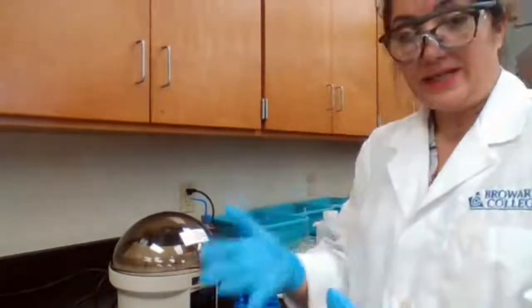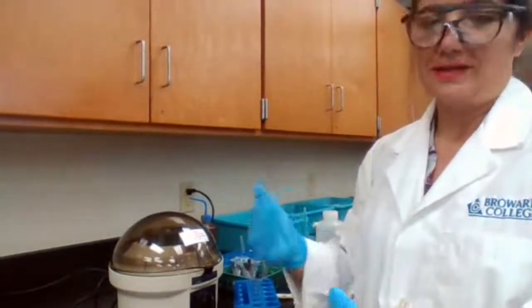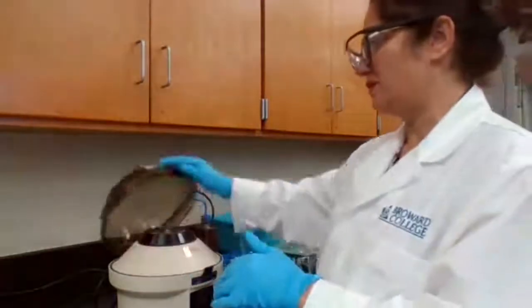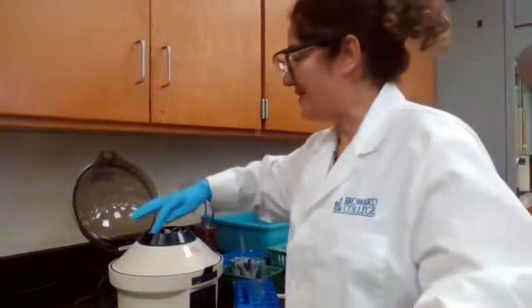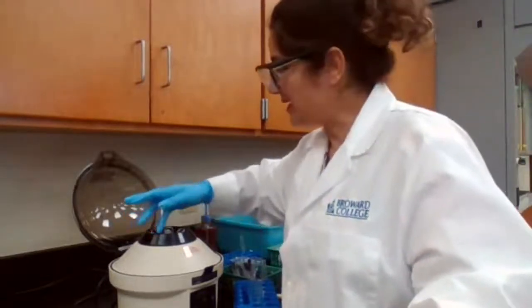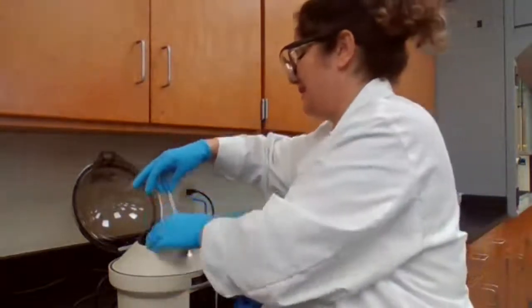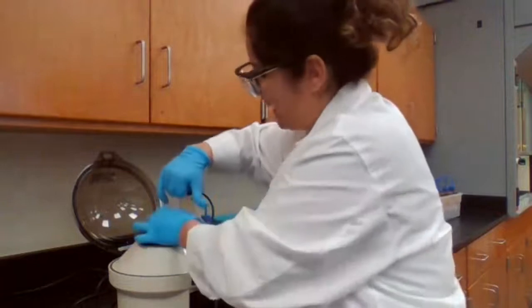But for titration, when you are using burette and pipette for exact measurement, 2 drops is going to make a difference in the concentration of the unknown. Here we're not trying to find how much we have of each ion. We just want to know if we have any of these ions or not. It's just the presence or absence.